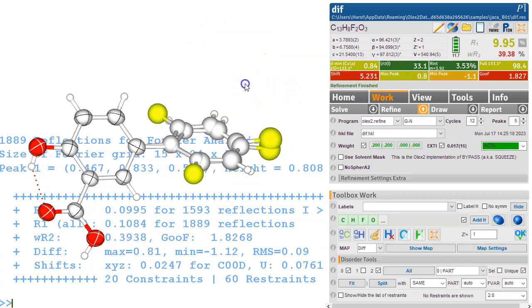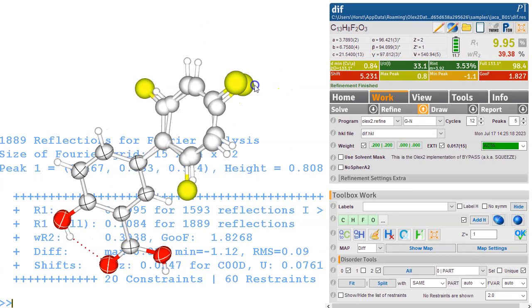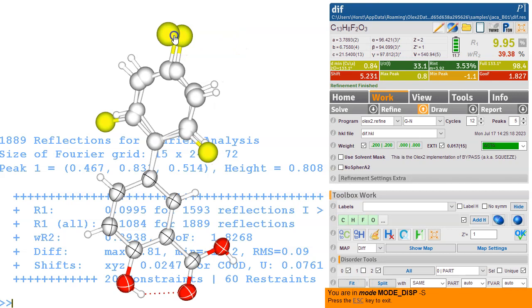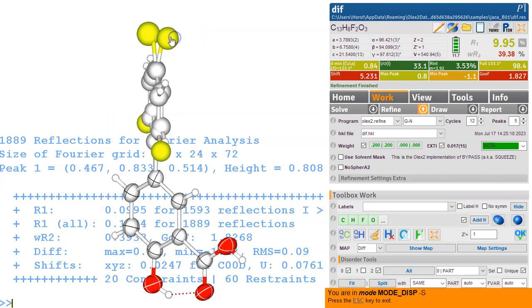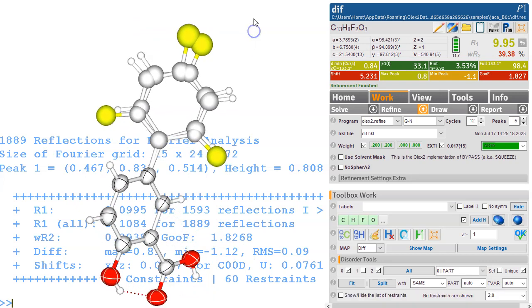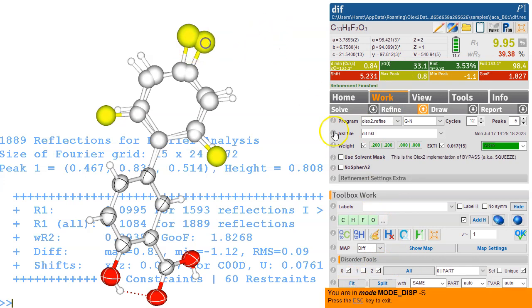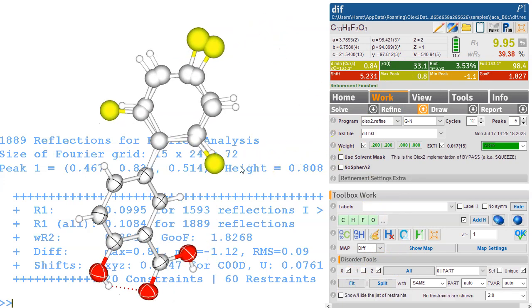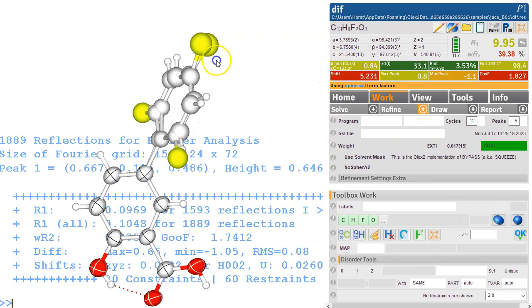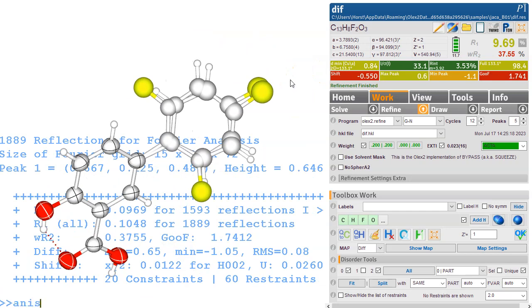So this may give us a stable refinement. It looks like it's not too bad. These ones look like maybe they are swapped over. If that happens, you can effectively fix that by pulling them where you want them. So this one over here, and then also aligning them. It's not cheating as such. It's just getting them into a right starting position. So maybe you want this out a little bit further, so give it a good chance to actually settle by itself. And I think this might happen here more or less. It comes together again. It's a bit strange. Anis, make everything anisotropic and refine that.